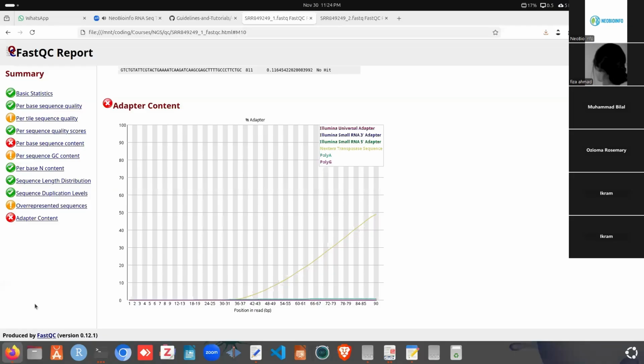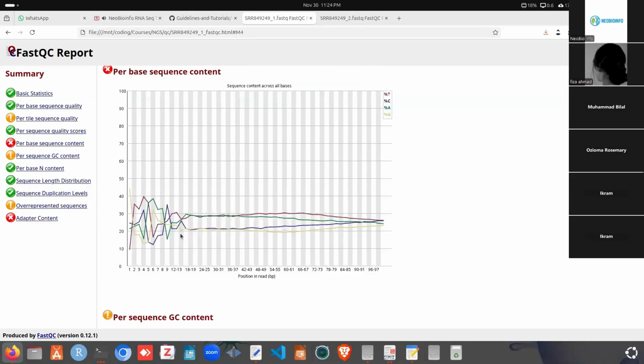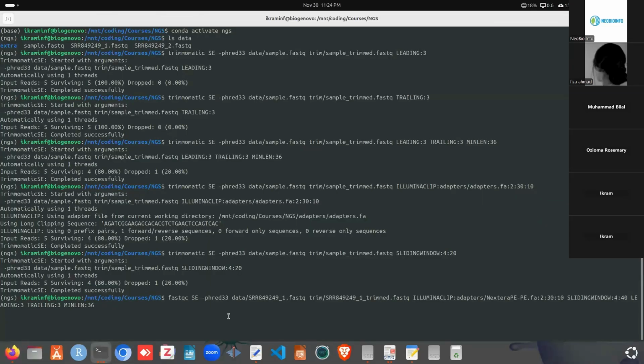For this read, we can see we need to remove these bases entirely. For that, we need to use another command, that is HEADCROP. What's the difference between LEADING and HEADCROP? LEADING checks the quality. If the condition is true, then it trims; otherwise, it keeps that. But HEADCROP doesn't have any condition, so it entirely removes the first 14 bases.